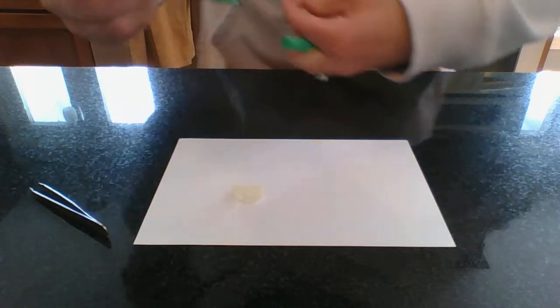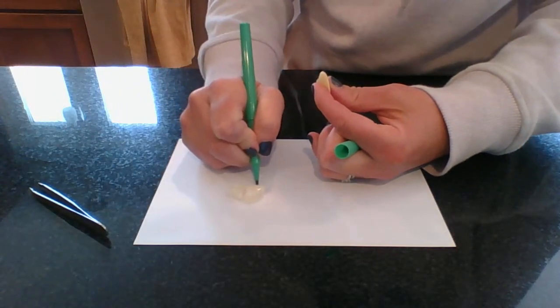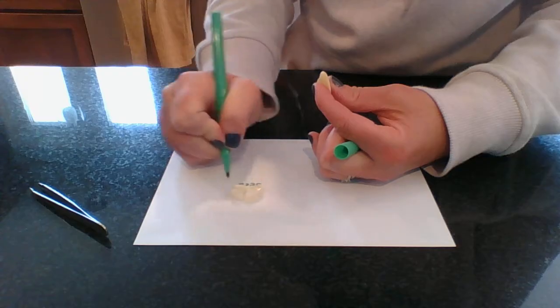I'm going to write that down right here. I'm going to label it seed coat.